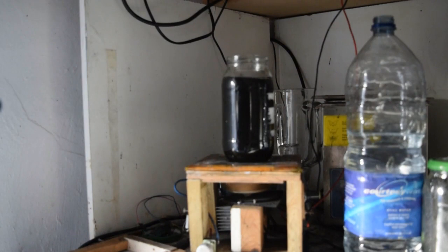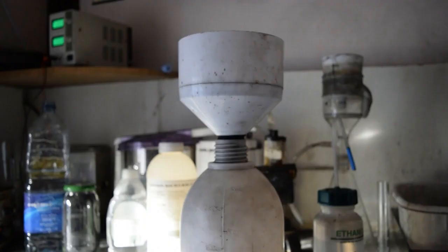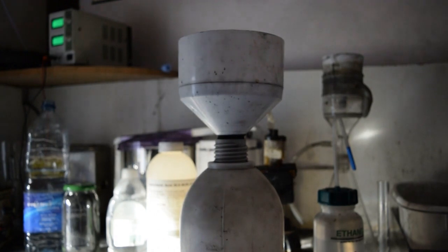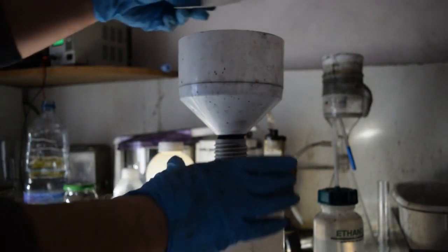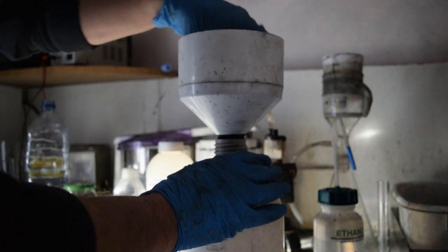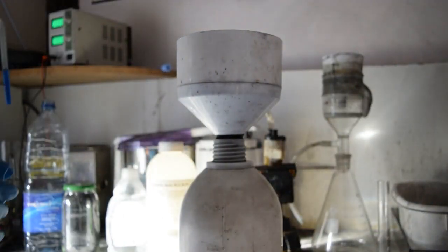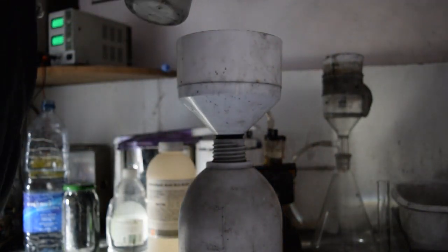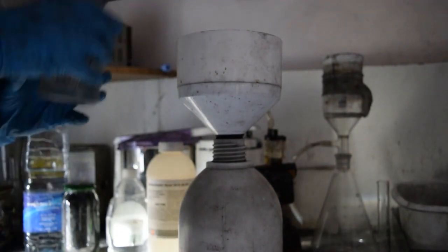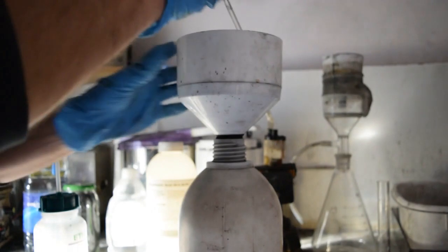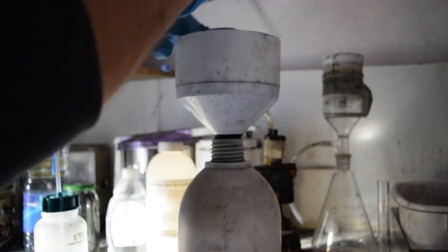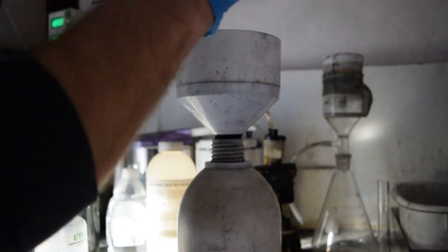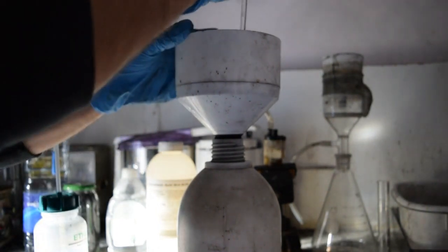You also get a bit of a smell as well. It smells a little bit like rotten eggs. So while that's still stirring, what we're going to do is set up the vacuum filter to filter out all the water with all the salts. We're going to finish it all up with deionised water. So it's deionised water in this wash bottle here and we're just going to wet the filter paper. Make sure it's all nice and flat. Switch on the pump.